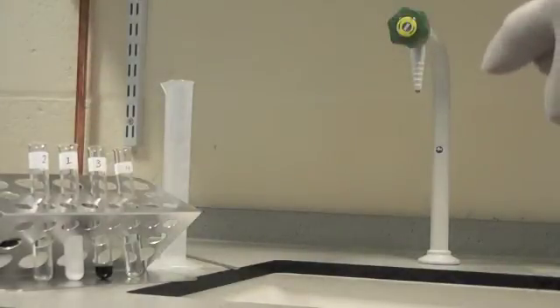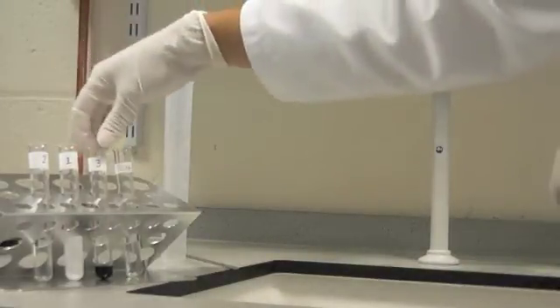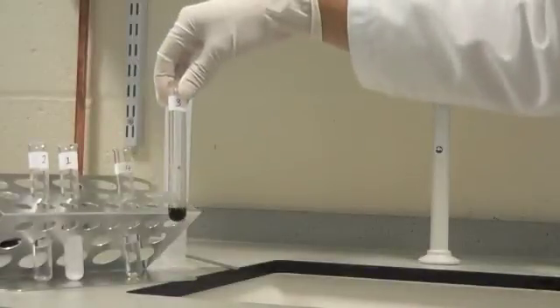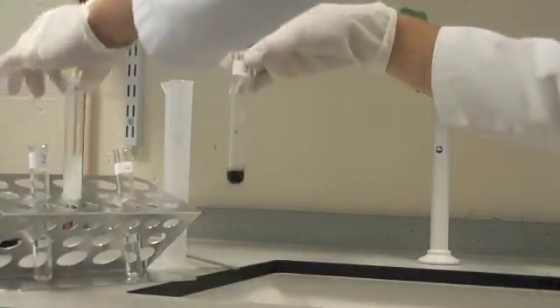Next, add the universal indicator, test tube three, to test tube one, and stir again.